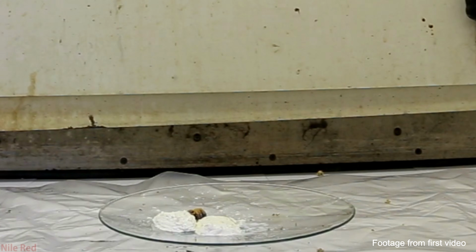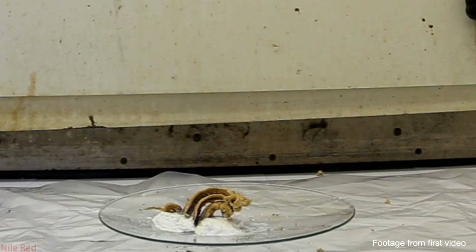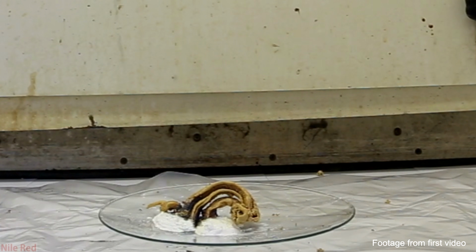Today we're going to be going back and revisiting the synthesis of mercury thiocyanate, also known as the Pharaoh Serpent. It's actually one of the first videos that I made, and it's my most popular video by far, but I feel if I revisit it, I can do a better job this time.